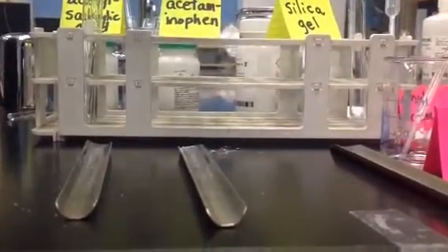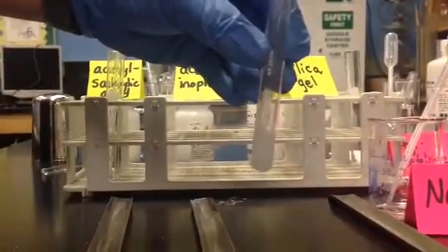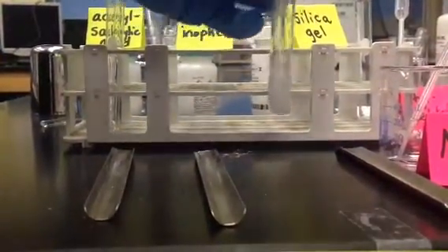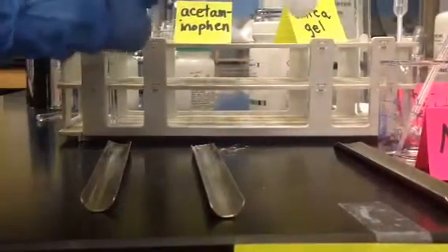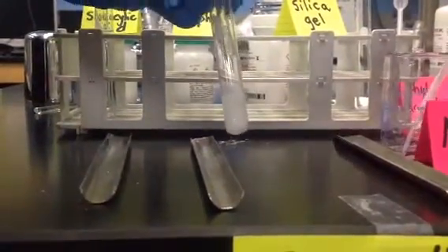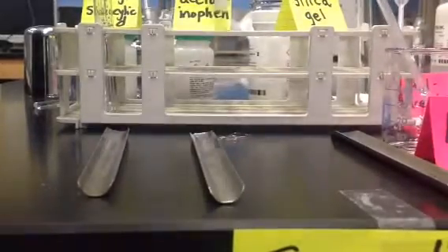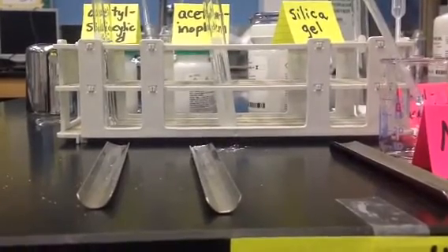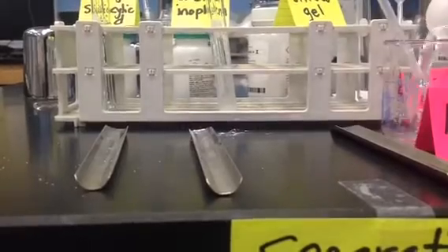That's a milliliter. And you can see, I think my ethyl acetate on the stirring rod, because I reused it, came out of that mixture. I think it was dissolving the acetaminophen, because it doesn't look like the sodium bicarbonate is dissolving it at all. You can see that you have solute particles still floating, so I'm going to add a little bit more. Well, I may have to go get some more. Sodium bicarbonate. Okay.